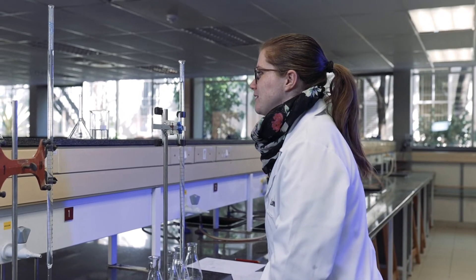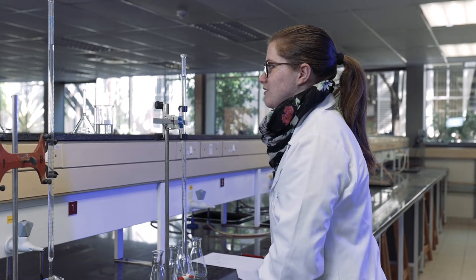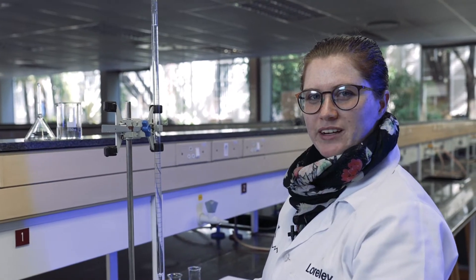Remember to always be eye level — some people may need to stand on chairs as I'm doing — but always make sure that your eye is level with the solution to be able to read the meniscus accurately. Now we are going to add 20 millilitres of sodium hydroxide into each of our beakers.